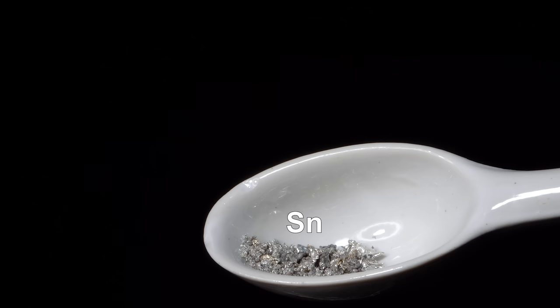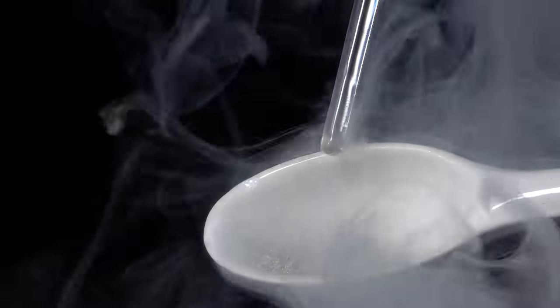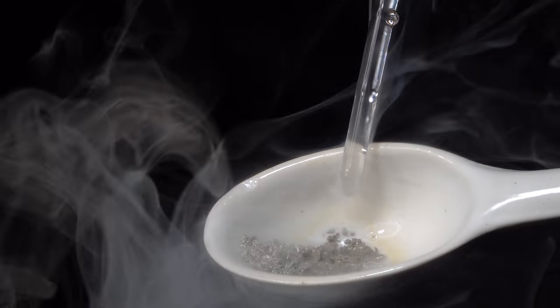The reaction with tin proceeds violently, resulting in the formation of tin tetrachloride, which is one of the liquids that emit the biggest amount of fume in air.